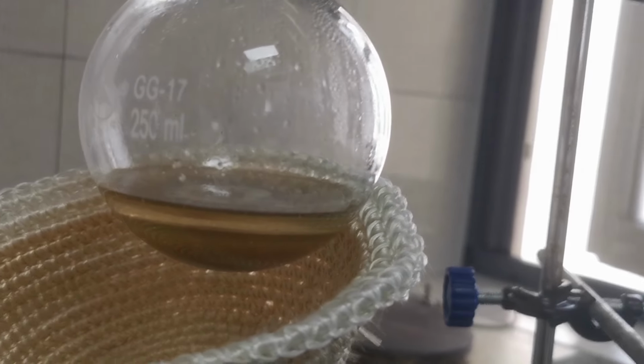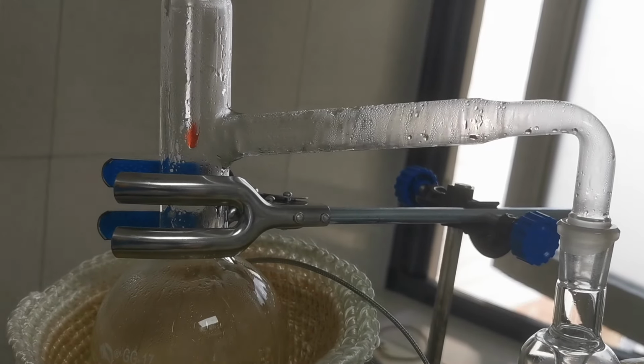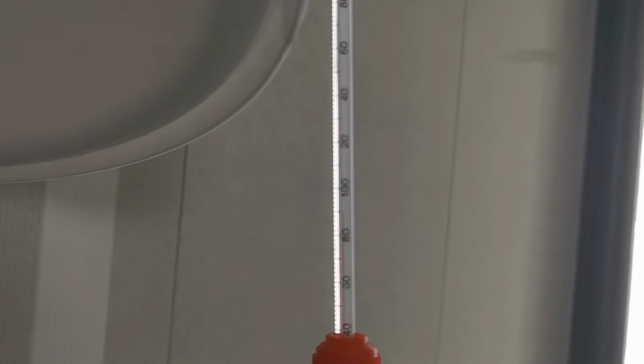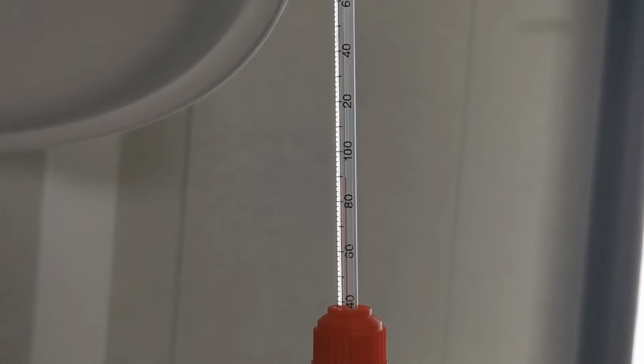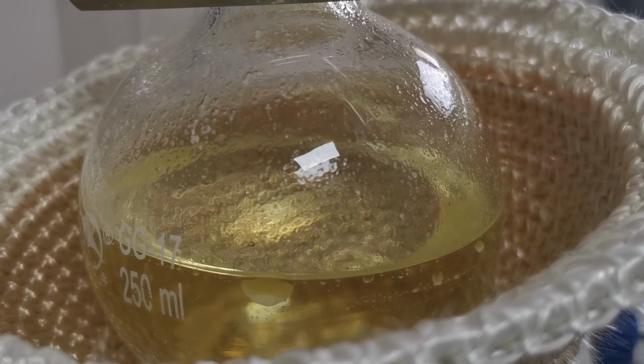Still, with the last bit of hope remaining, I added in 20 grams of acetic acid. The acetyl chloride formed should distill off at around 50 degrees Celsius, and it did not. The temperature shot up to 90 degrees Celsius, and I started to smell some acetic acid in the distillate. So yeah, this big project was kind of a huge failure.